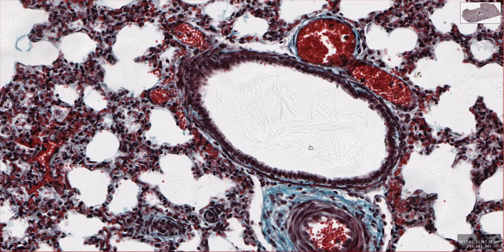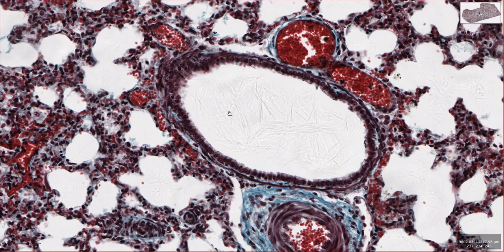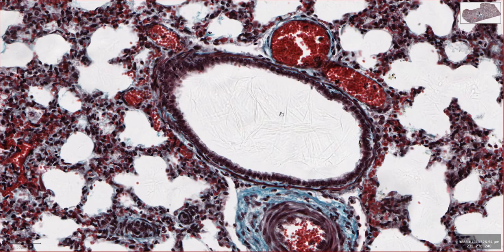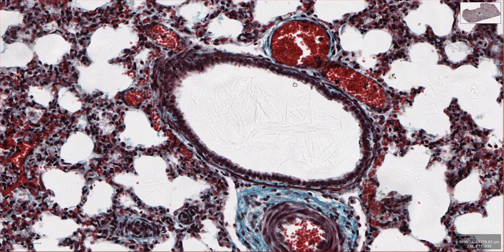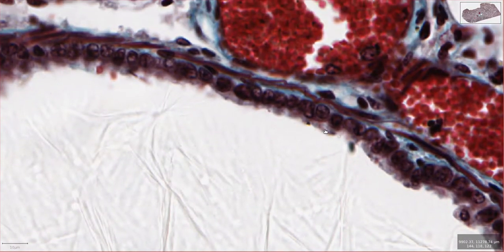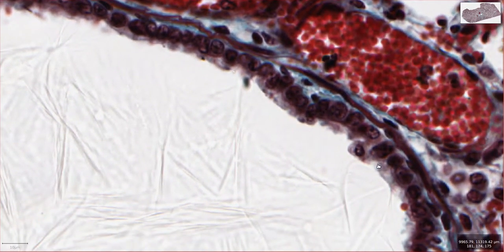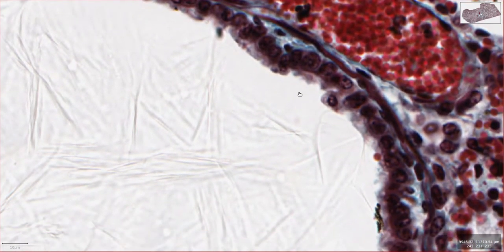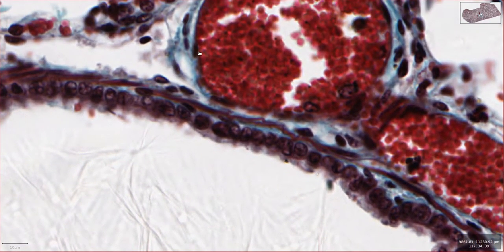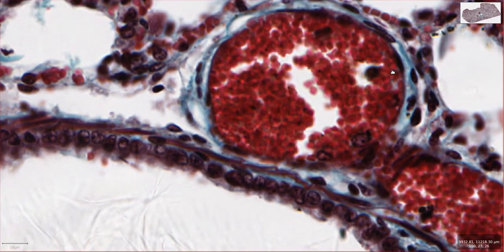If we have a quick look at this other structure here, this is a bronchiole which you might confuse with a blood vessel. It has a lumen and it's quite round, so why is it not a blood vessel? The key is in the epithelium again. We have this columnar to cuboidal epithelium with a little bit of fuzz on it — so ciliated — and if we compare that to the endothelium of this blood vessel here, it's squamous with little dark elongated nuclei.